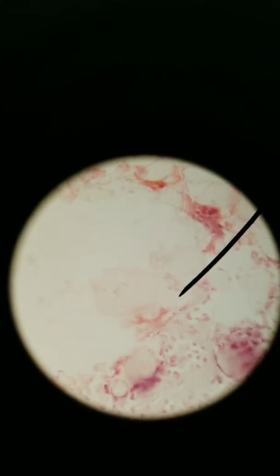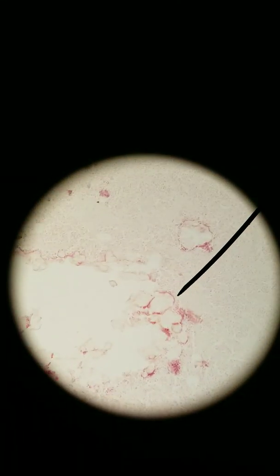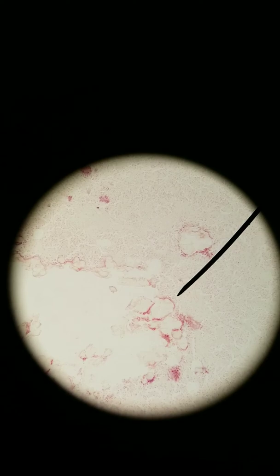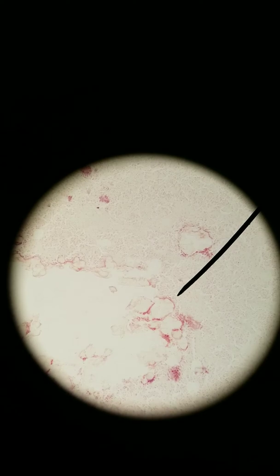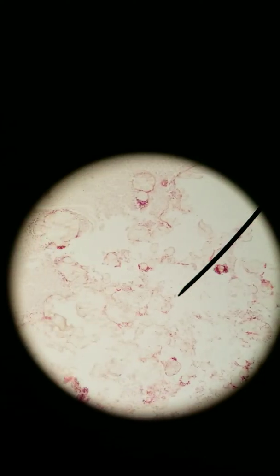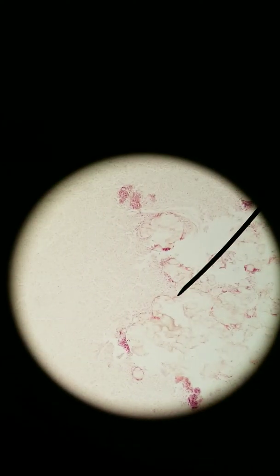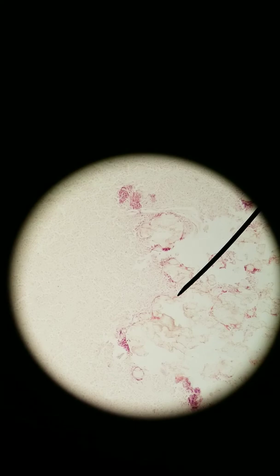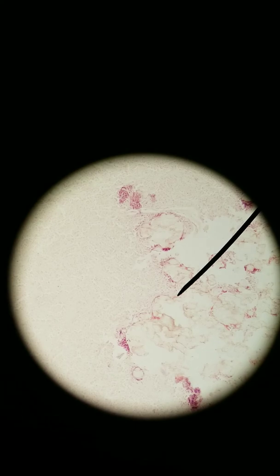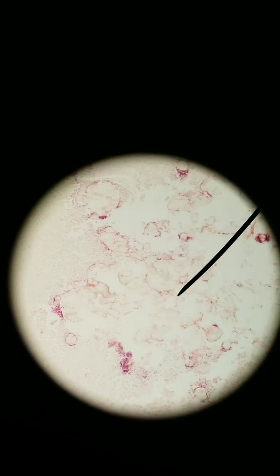What is distinguishable are these other things that aren't cells. You've got these weird clusters of things — they're concretions of mineral. The colloquial name for them is brain sand. You've got all this brain sand in your pineal gland. There's no real understanding of what it does or why it's there. We just know that the older you get, you tend to have more.